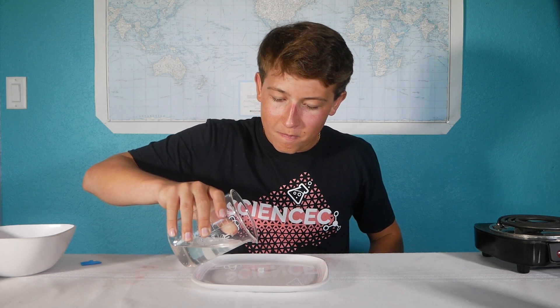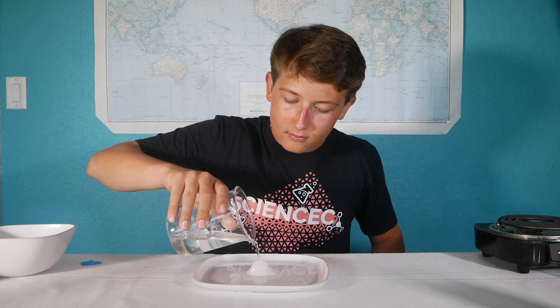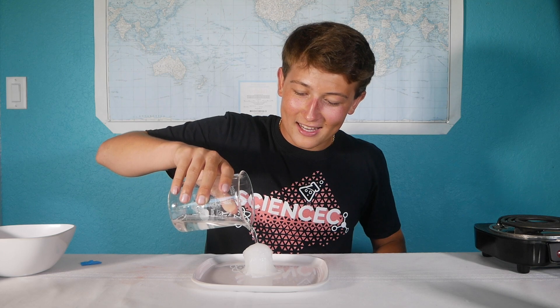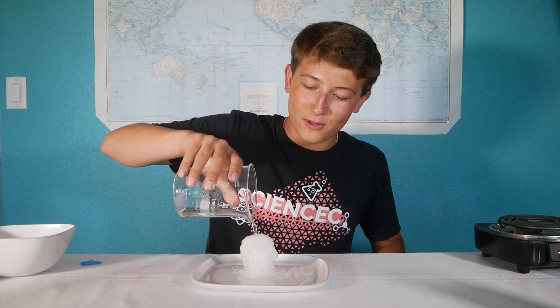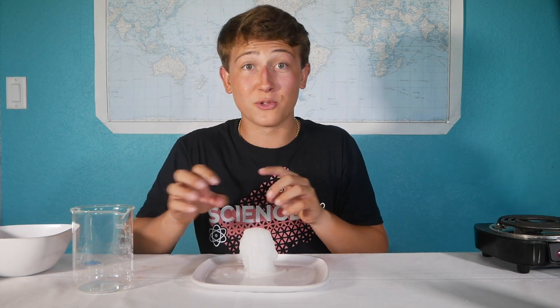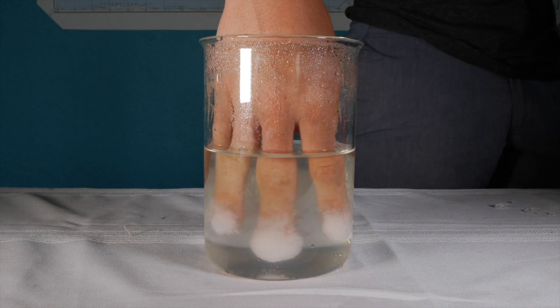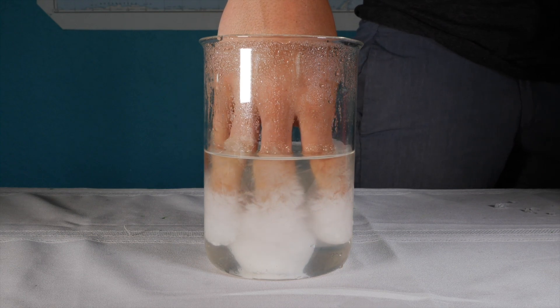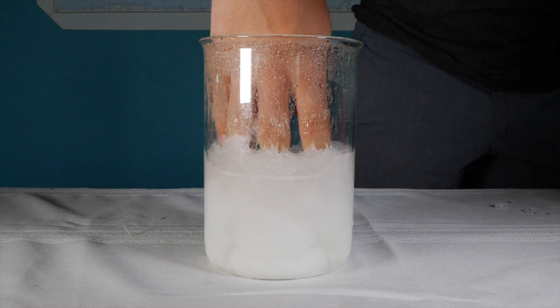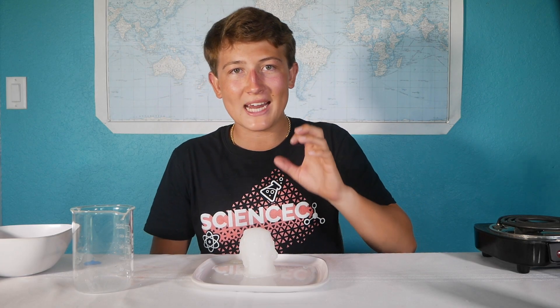So let's make another tower. This is still so cool — it really never gets old. We can even pour it fast and we see that it still builds up quite a bit. In addition to making these crystal towers, you can even put your entire hand in a solution of sodium acetate, as long as you have a few little tiny pieces on your fingers. However, if you try this at home, you'll notice that it's super, super hot, like almost unbearably hot.